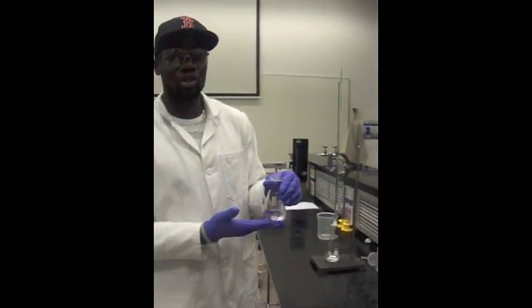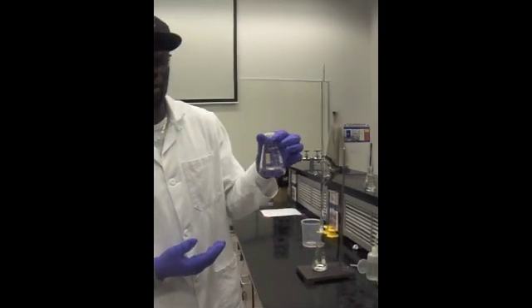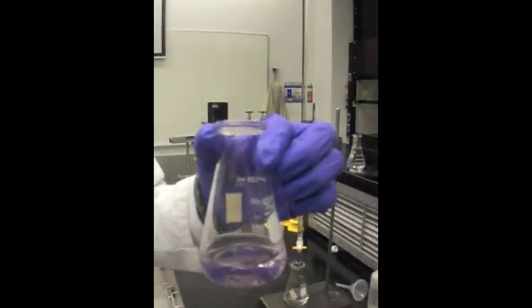This is an example of what you want your solution to turn out to be. It's a very slight pink color, which means that the solution is very slightly basic and it's going to yield better results.